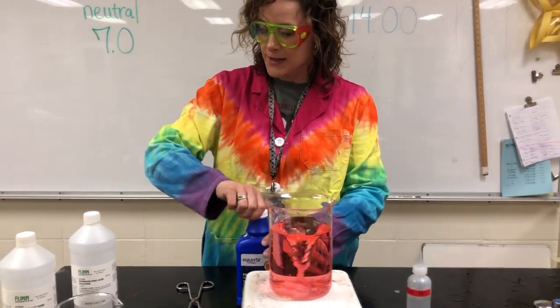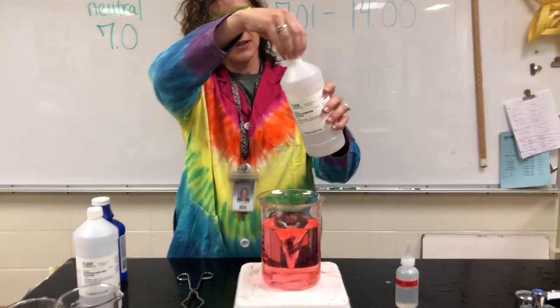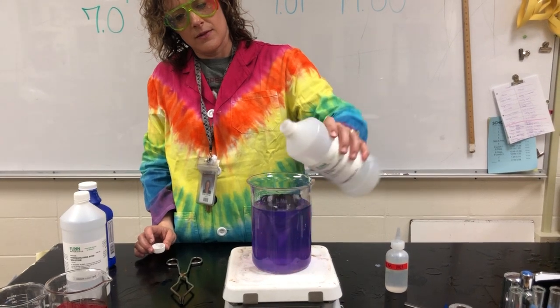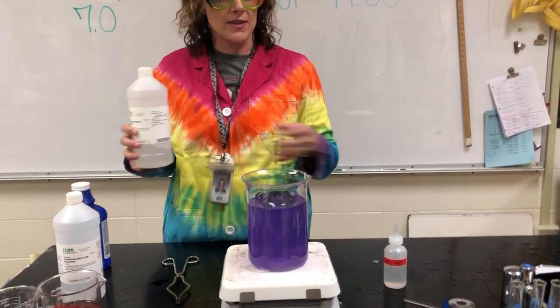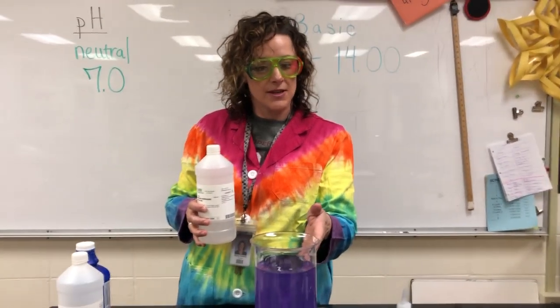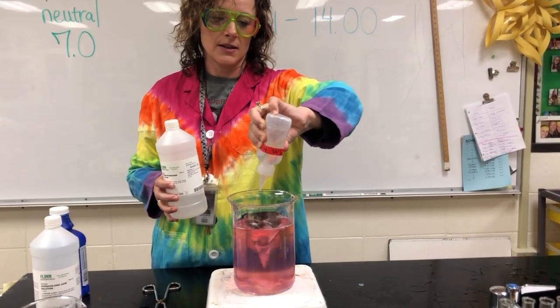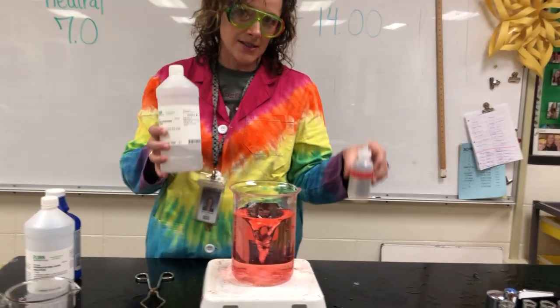Now, if we wanted to have a little fun, I could probably throw in this base, so let's just see. And my guess is we can get it to go back to more of that blue side. Now I've got a strong acid, strong base. It's going to be hard for it to go anything in between, but we can show the actual indicator did not get used up here. Indicator stays, but it's the acid and the base that changes the color. So we put the acid back in, and it's going to go back to pink. Harder to show those in-between colors with strong acids and strong bases.